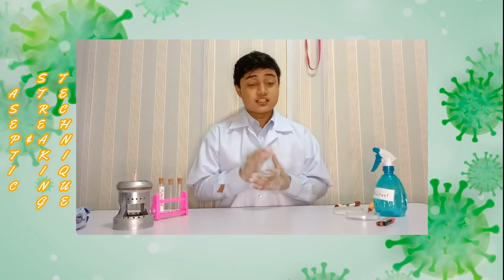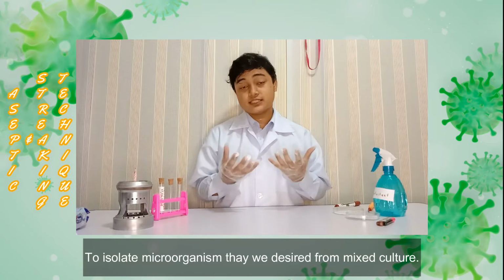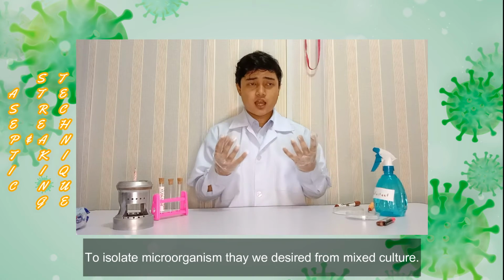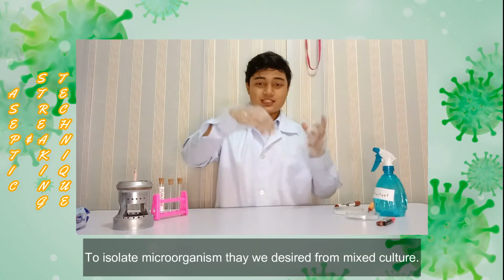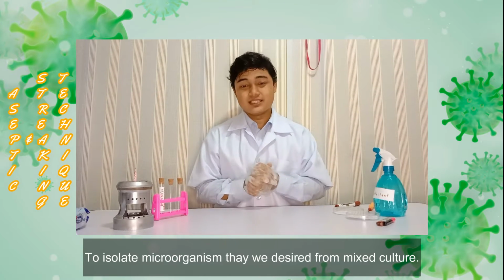and we get our desired microorganism only. While streaking technique is a technique that we can use to isolate microorganisms from a mixed culture. We use the streaking technique when we want to isolate from a mixed culture onto another plate to get a pure culture of the microorganism that we desire.